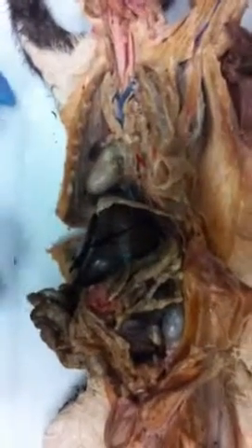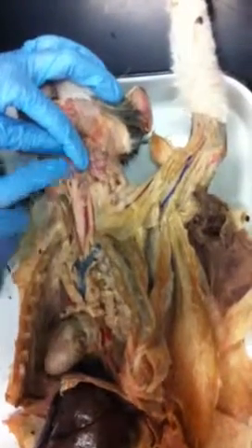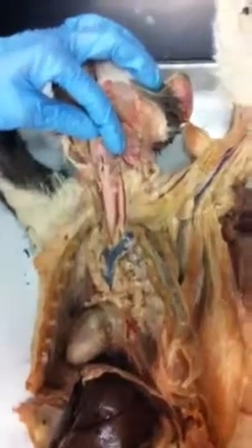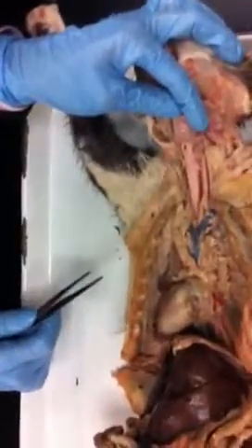Now if we look at respiratory structures. So again, here's the trachea. This big bump here, this big cartilage here, these big plates right here and right here. Those are the thyroid cartilages, and those correspond to these right here. Thyroid cartilage. The bump on the front, that's the Adam's apple.